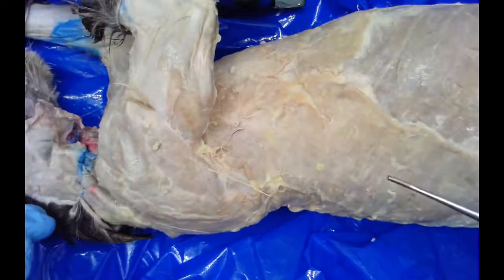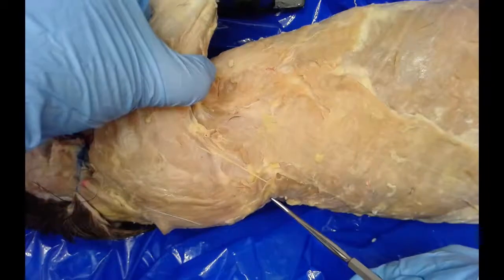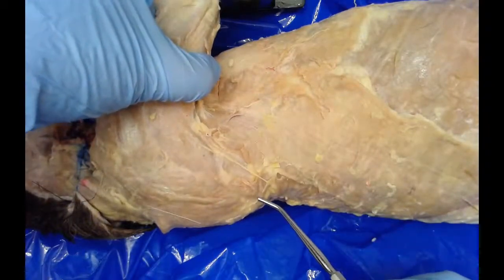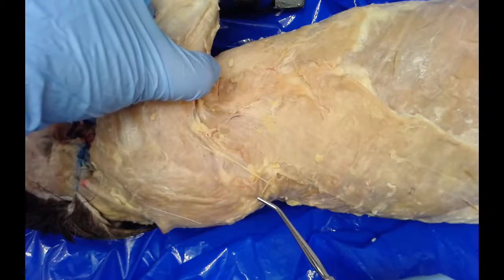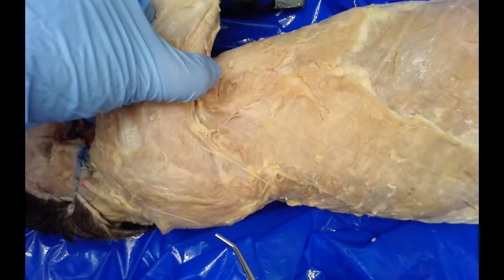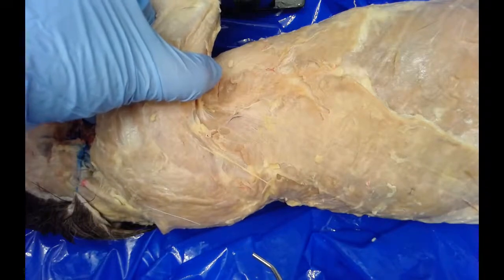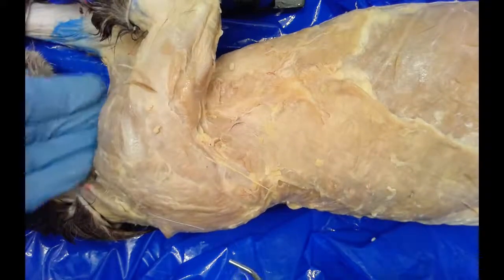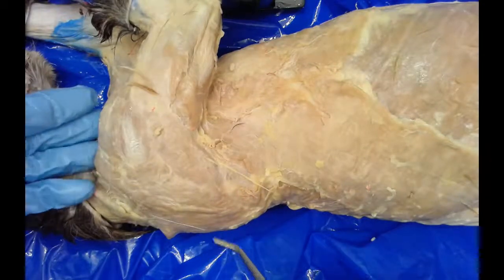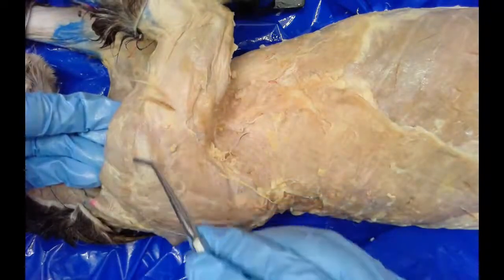We have the trapezius muscle, which forms an area that comes down and forms a V in the back. For bodybuilders, it's what forms that upside-down triangle at the top of the back — that's the trapezius muscle. It has three different parts that all fan out from the shoulder along the back, covering the shoulder blades, and functions to draw the clavicle — our collarbone — dorsally and towards the head. The last muscle in this area is the deltoid, which is the shoulder muscle. It has three parts, though only two are visible, and helps the cat flex the shoulder.